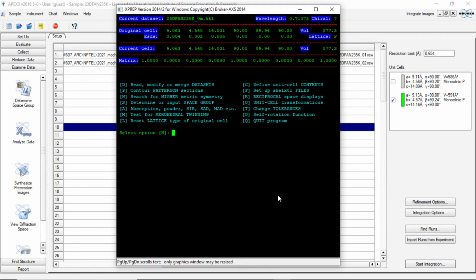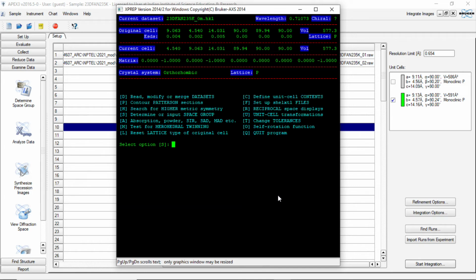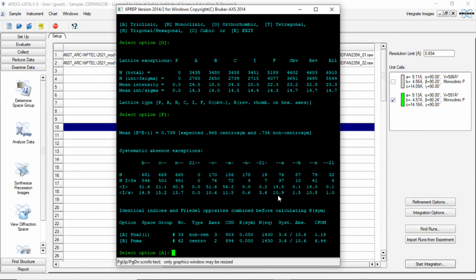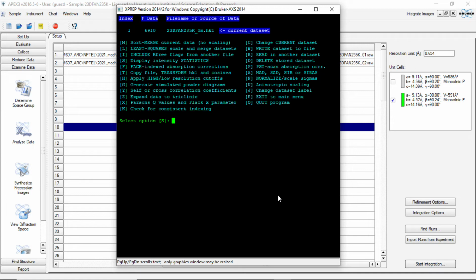H means search for higher metric symmetry, and then here it says it may be orthorhombic. At the moment, now let us assume it to be orthorhombic, and then space group, orthorhombic, primitive, and it then says it may be PNA21 space group. We accept it, and then it is D, which means read, modify or merge datasets. This is the point where we should call our other data, which is the data from the green crystal.